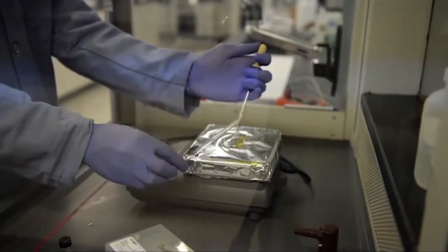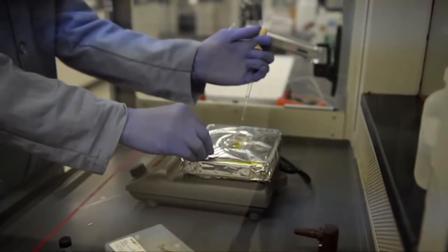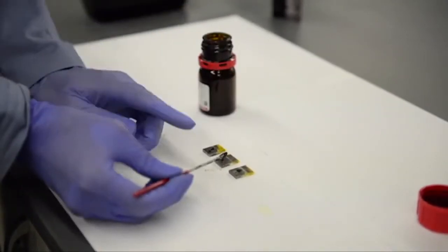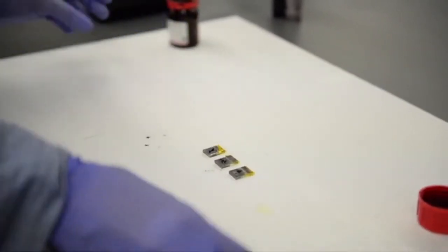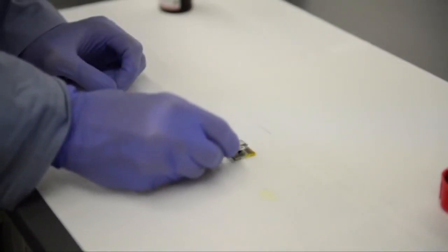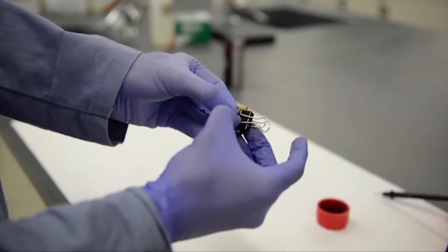We deposit 1 drop of copper thiocyanate solution and quickly spread it across the surface with a glass pipette. Now place the glass piece on the benchtop, scoop a small amount of carbon particles with a spatula and sprinkle them onto the glass piece. Finally, we close the device with another piece of FTO glass with the conductive side facing down, and we hold the device together using binder clips.